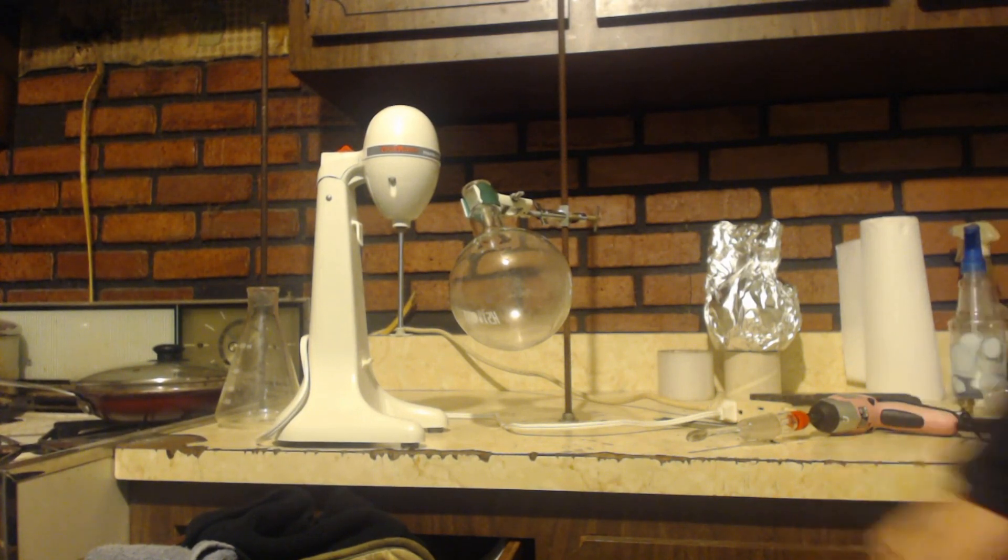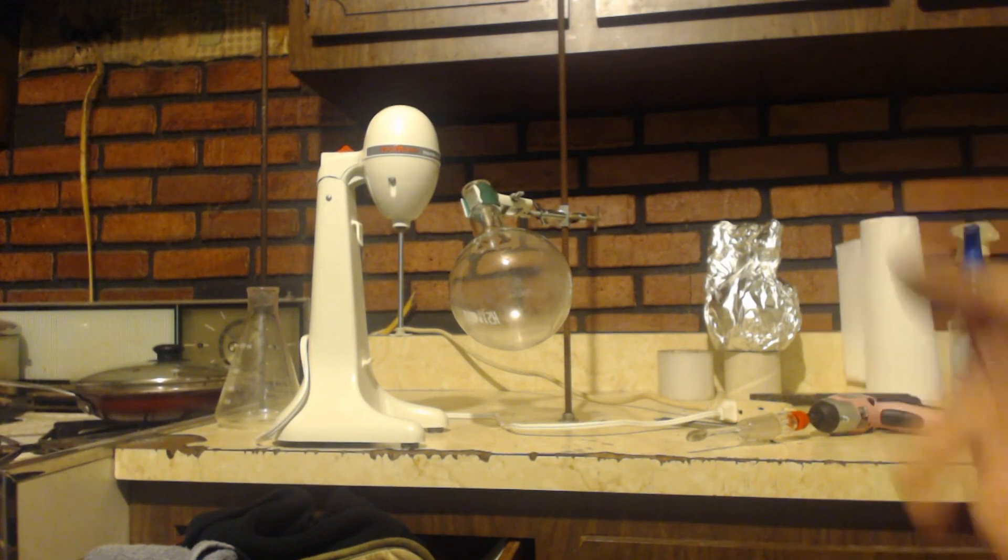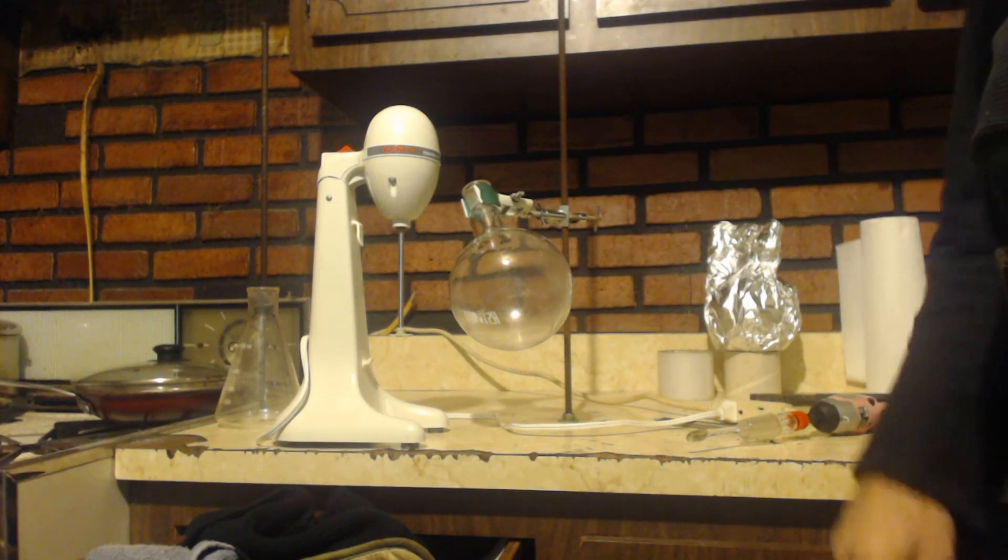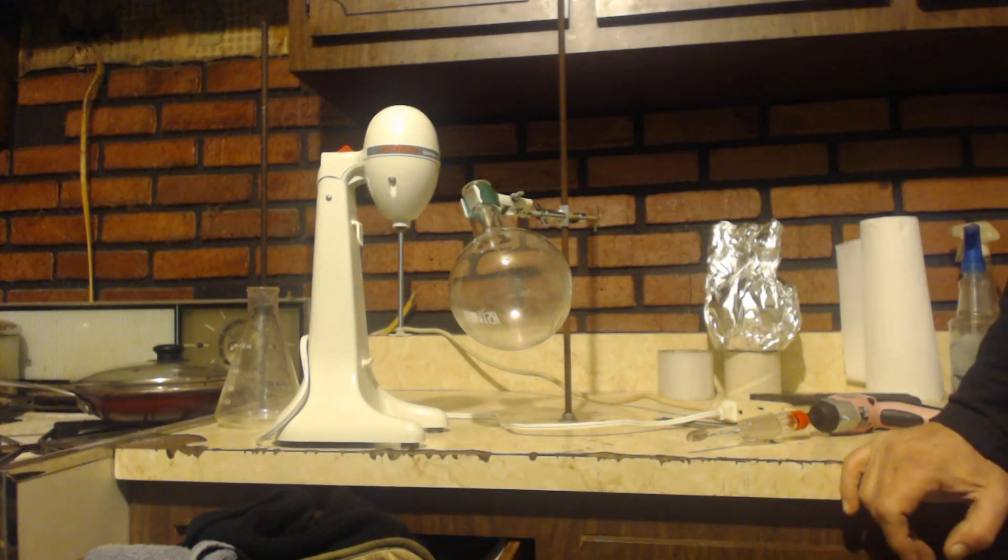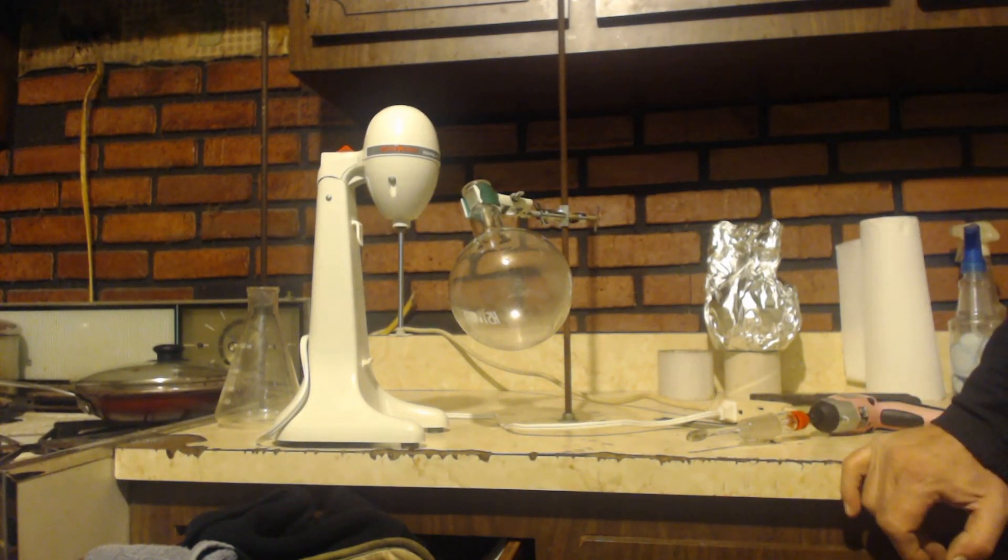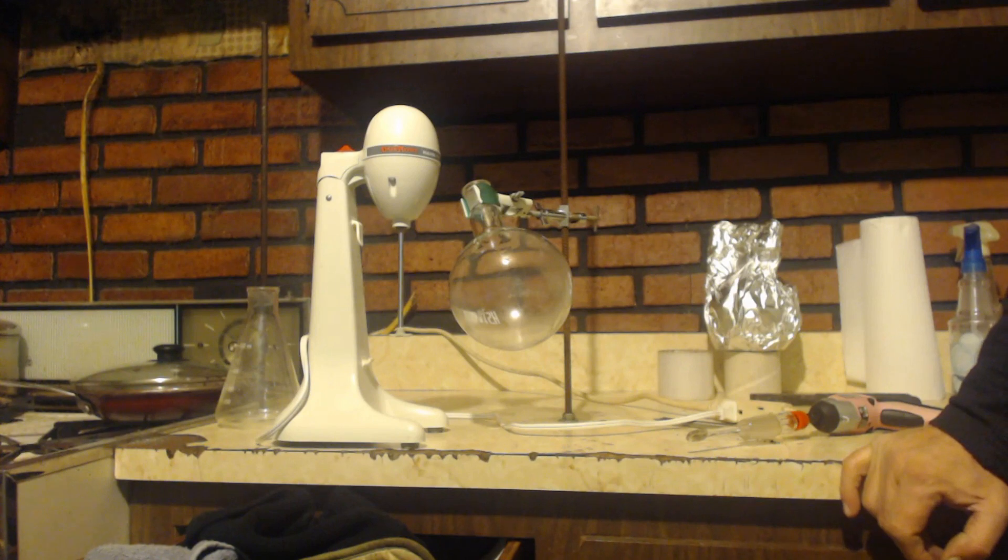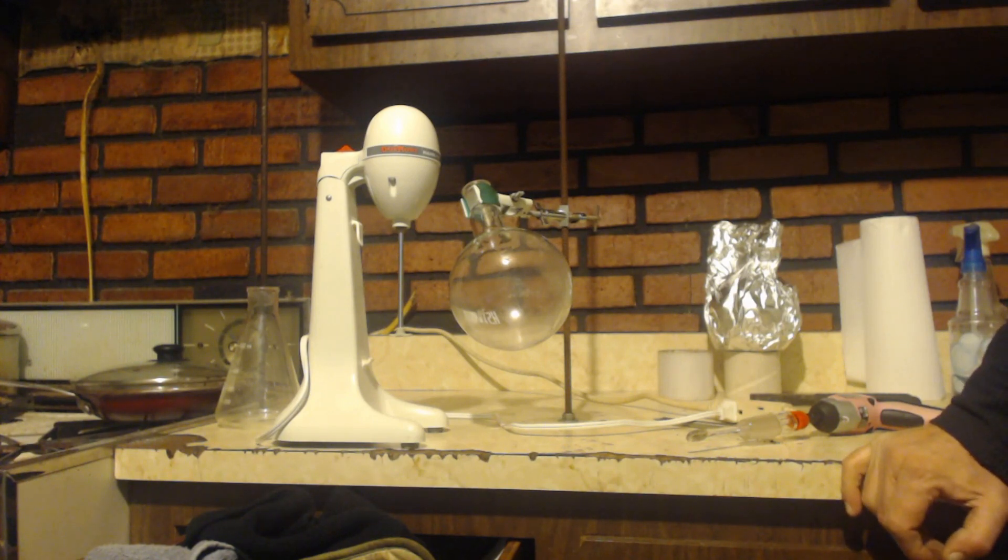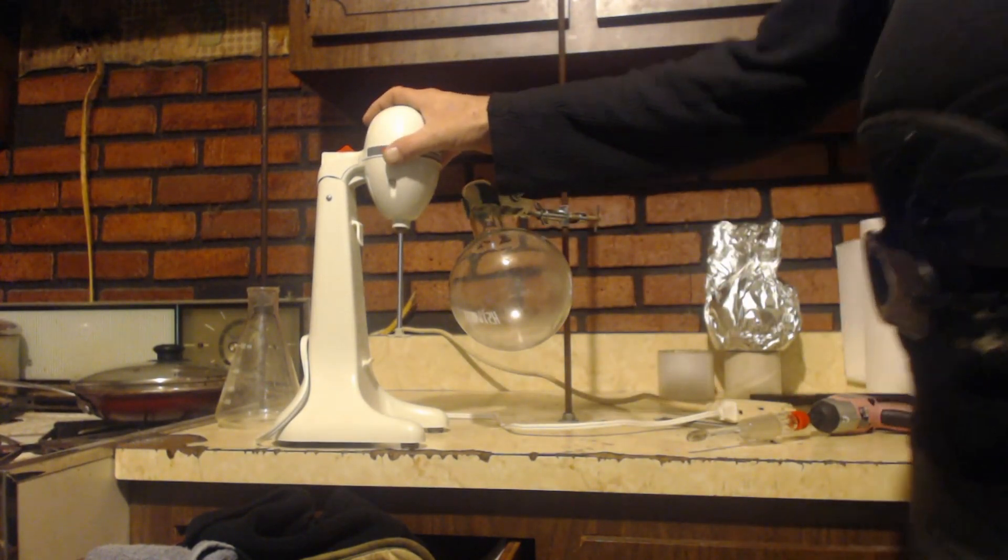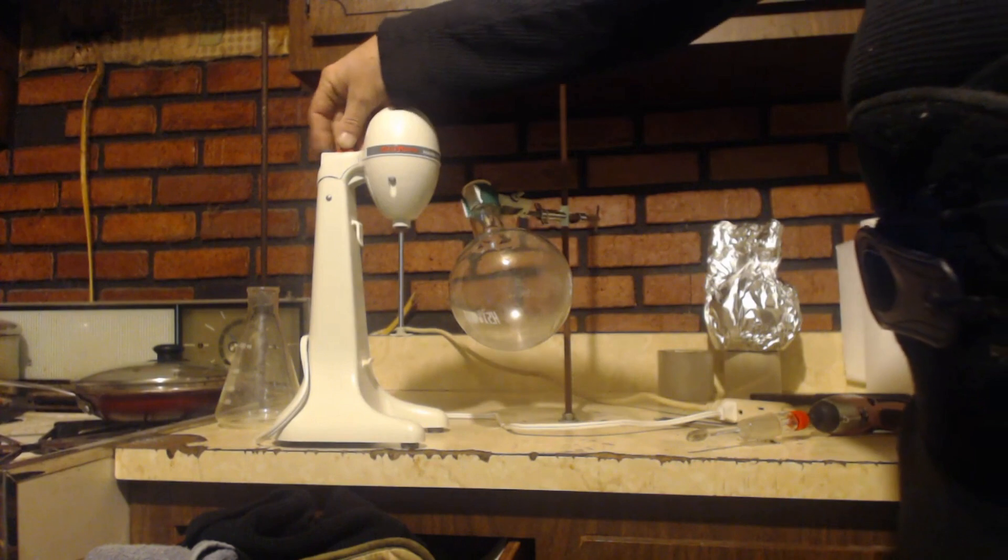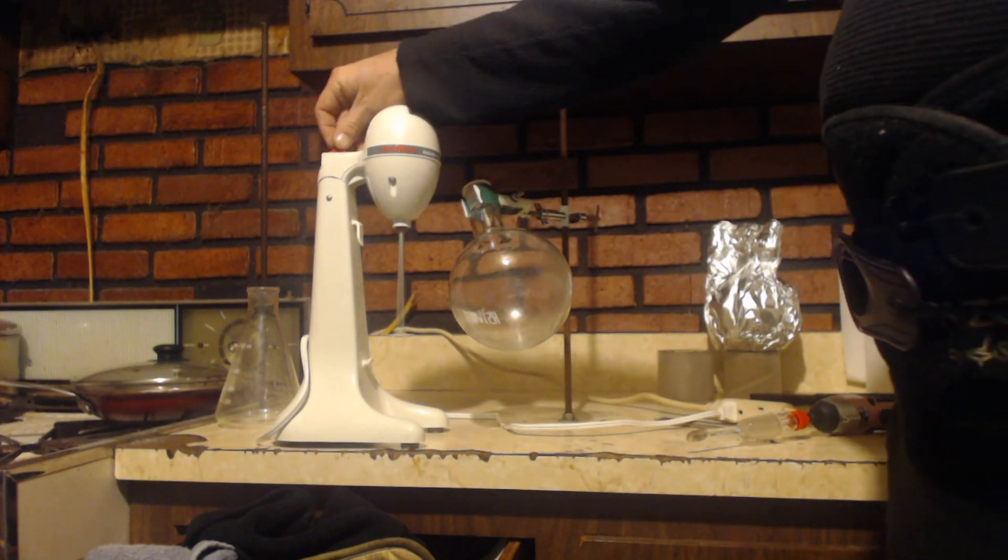Because magnetic stirrers can only stir so much, you only have so much power. Anyways, here's a couple examples of ideas I'm having about it. This is a blender, one from the olden days.